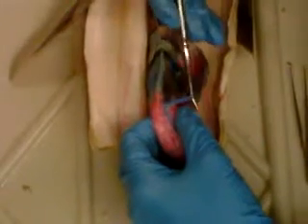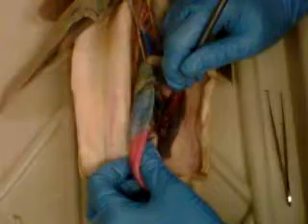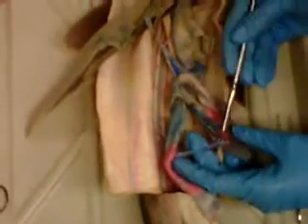Anterior. Is that what it says? I'm sorry. Anterior intestinal. I hope I said that. So down here it's the posterior intestinal, and it's going to connect with the spleen, and it's called the posterior splenic vein. And it's going to actually connect back up to the lienomesenteric, which is down here on the bottom of the pancreas. And I think that's it.